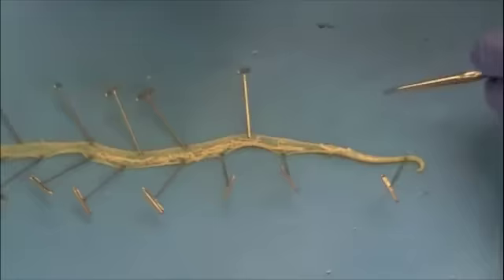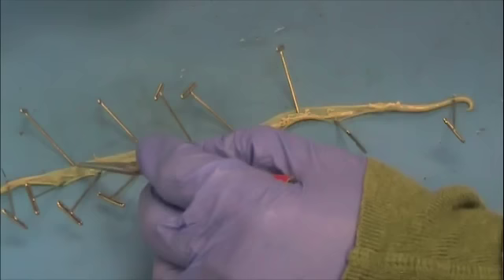One other thing that you can see is a very thin, faint line. There are two of them on either side of the gut. These are the lateral lines which allow the Ascaris to contract and move.